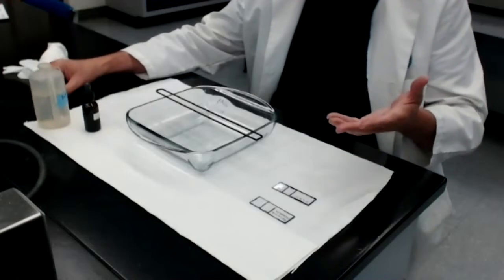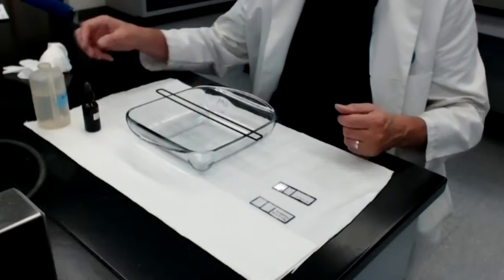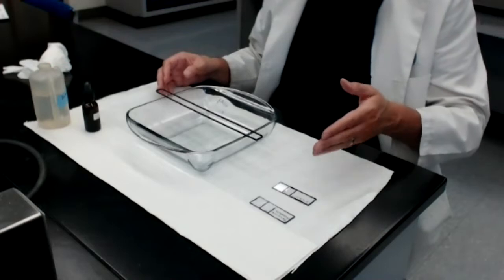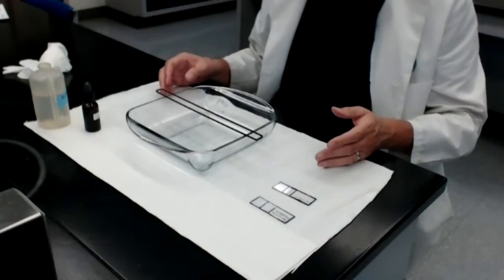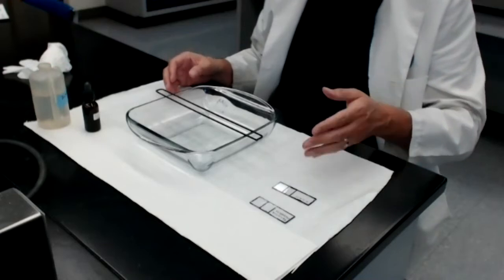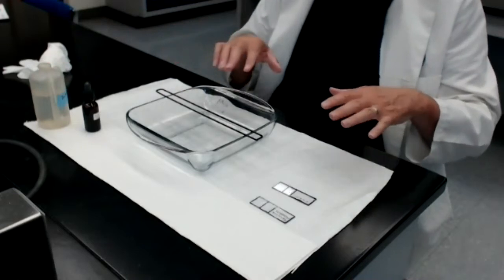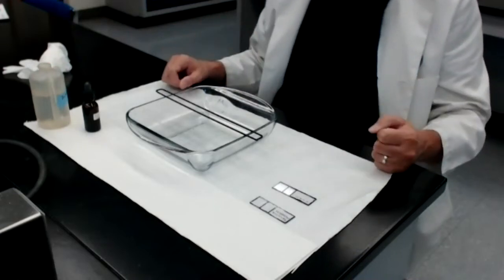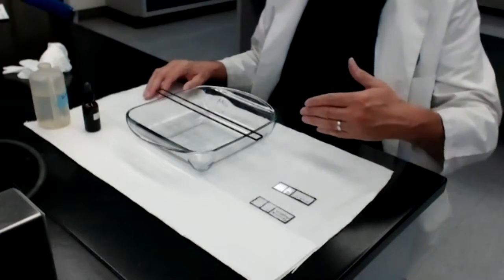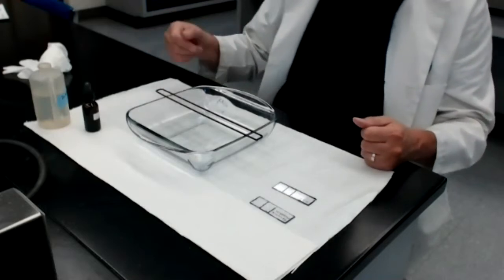Now, as my slideshow points out, dyes can be broken into two groups, basic dyes and acidic dyes. Basic dyes will directly stain or give color to the bacteria. Acidic dyes do not give color directly to the bacteria. Instead, acidic dyes will stick to the glass slide and not stick to the bacteria. All the staining protocols that we are going to do in this class will use basic dyes like methylene blue.